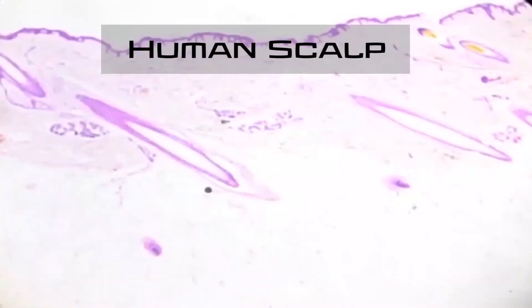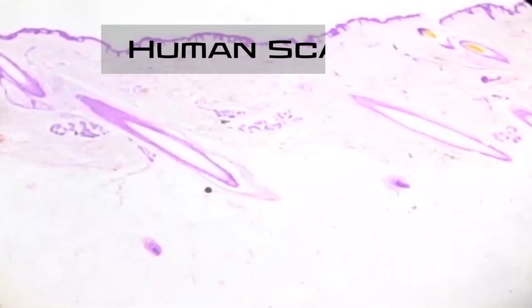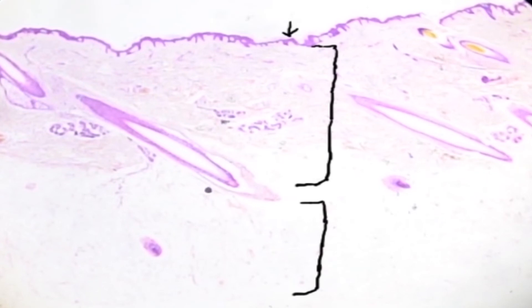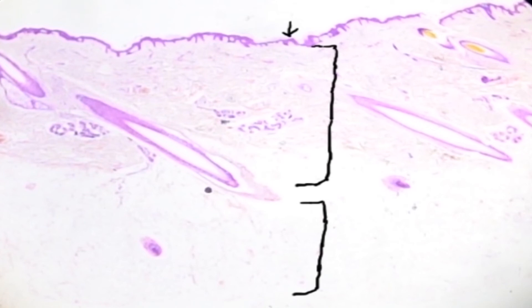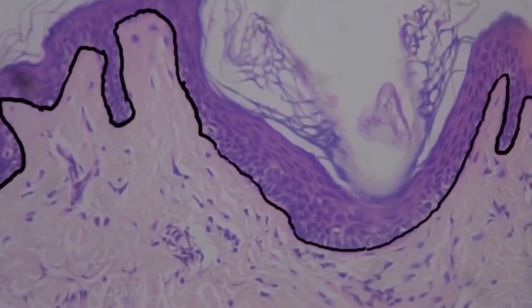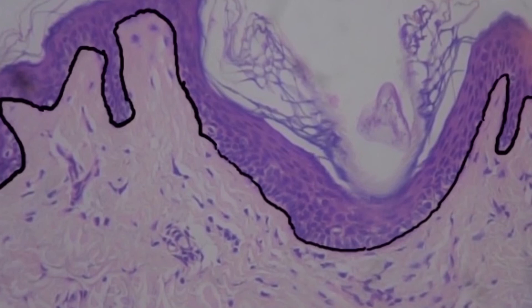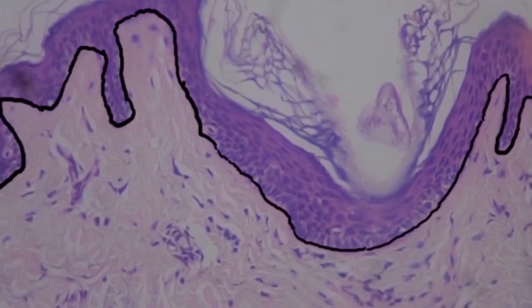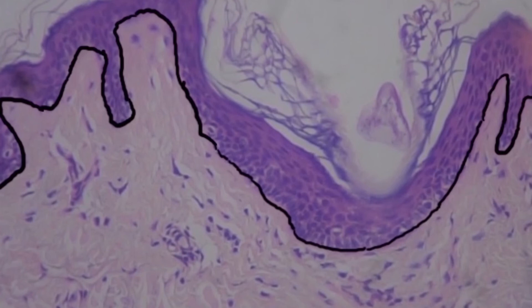The next slide is a human scalp, so we're looking at skin. There are different layers: the dermal layer, which is mostly connective tissue; below that the hypodermal layer, which is mostly adipose tissue or fat; and way up at the top, this thin purple layer is your epithelial tissue known as your epidermis. Zooming in to the epidermis, we label the basement membrane separating the epithelial layer from the dermal layer. We can see this is a stratified epithelial layer — there's a layer of cells touching the basement membrane directly, with multiple layers on top of those.